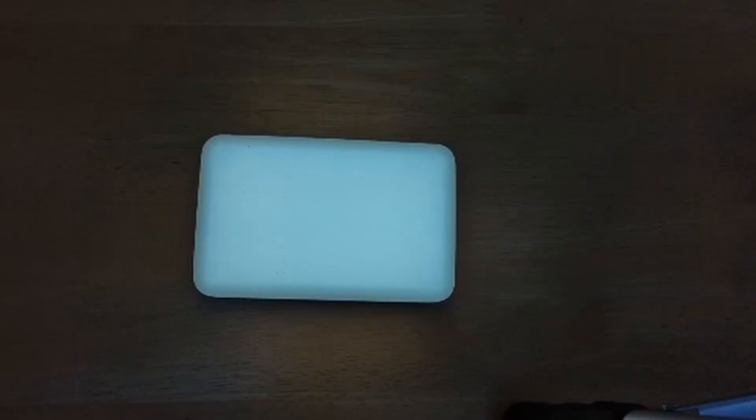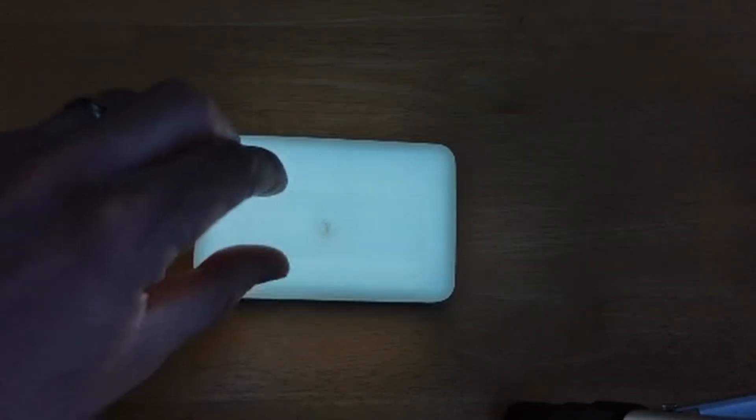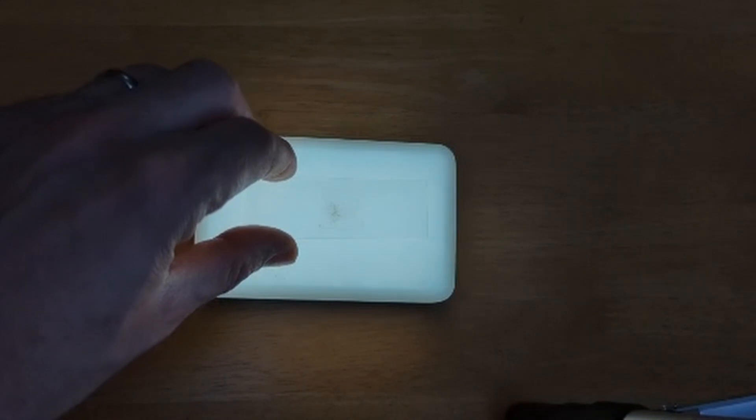I actually found an old light source — this thing, which I used in some of my early videos — which made the perfect light stage to put the slide on before assembling my smart microscope over the top. So once I had everything set up, I actually got a nice little workflow going.